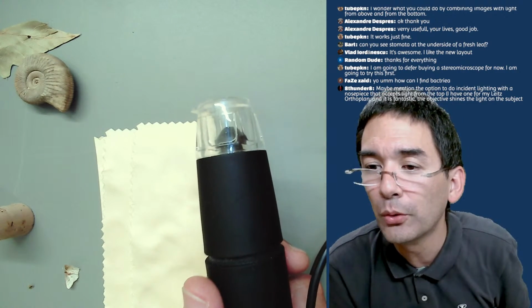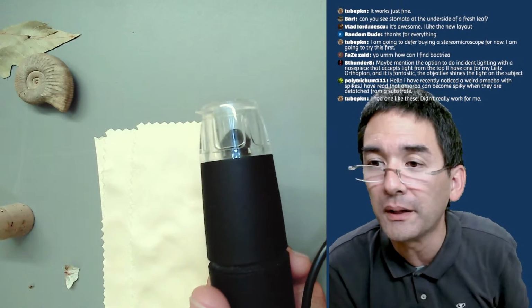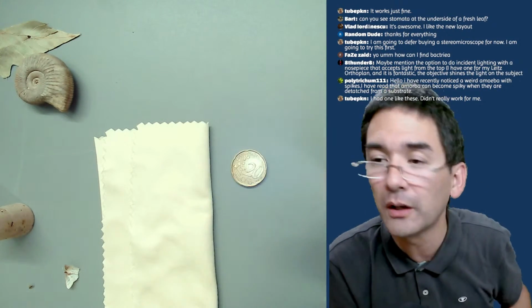Okay, a couple of questions more. How can I find bacteria? That's a huge topic, bacteria. I can also do that.